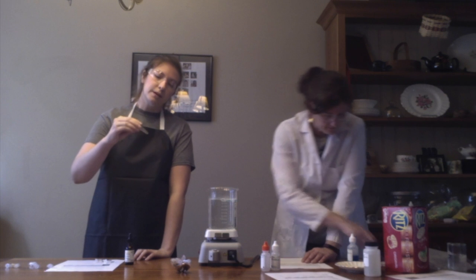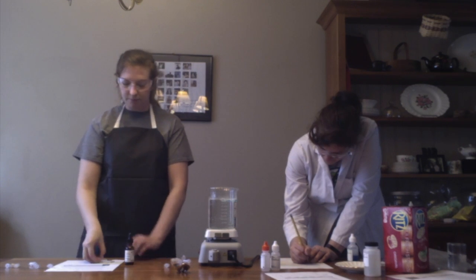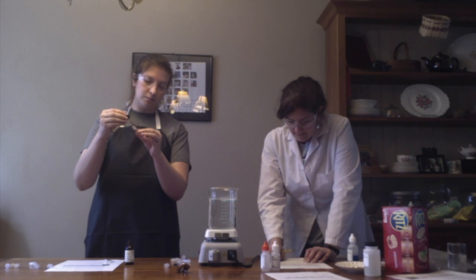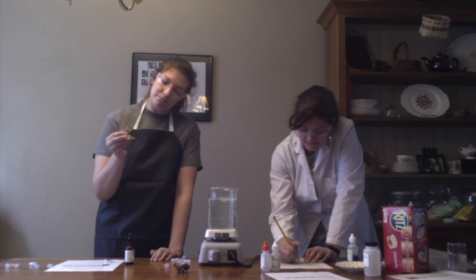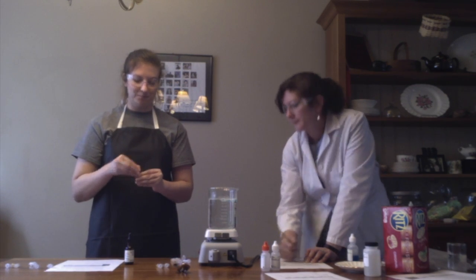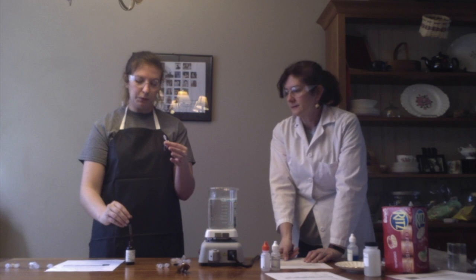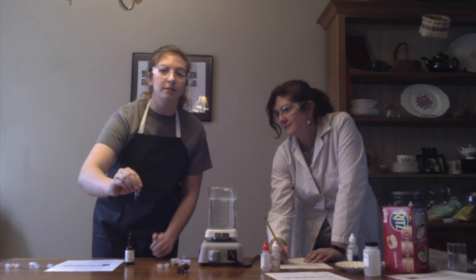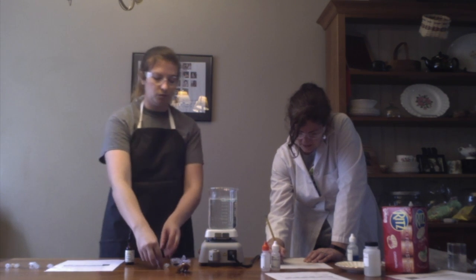So the water, it's a very pale yellow, just looks like the iodine's been diluted. With the glucose, it looks yellow, also like it's been diluted. Ooh, when you put it in the starch, it turns this very vivid brown color. It's almost like a purpley brown. Okay, can I have those over here to take a picture?